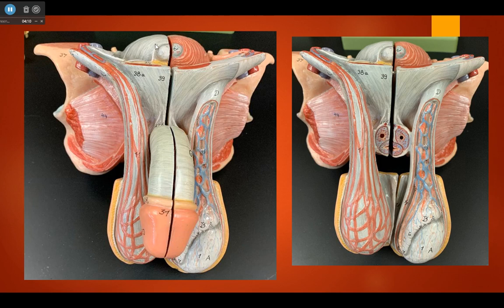And then we have the bladder up here. Removing the penis so we can see structures. Again, we have the testis, we have the epididymis, the head of the epididymis, the tail of the epididymis, the vas deferens, the spermatic cord, and this little red guy on the outside is the cremaster muscle. We have the raphe that separates the two testes from each other, and we have the scrotum. And we can see the corpora cavernosa and the corpus spongiosum and the penile urethra right there.